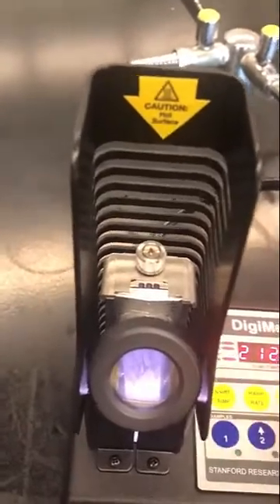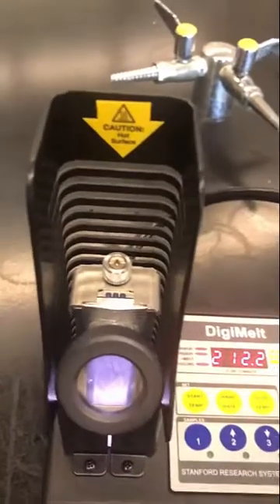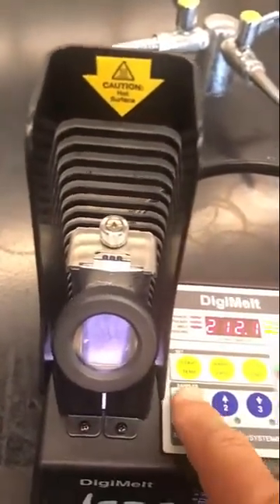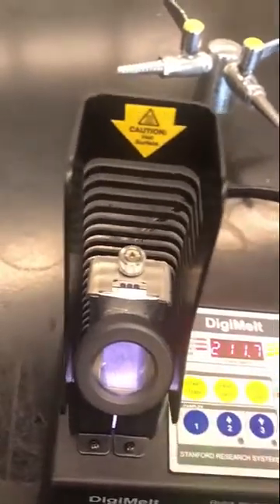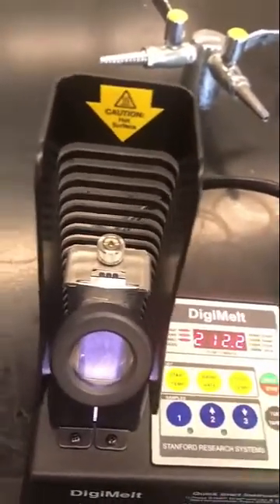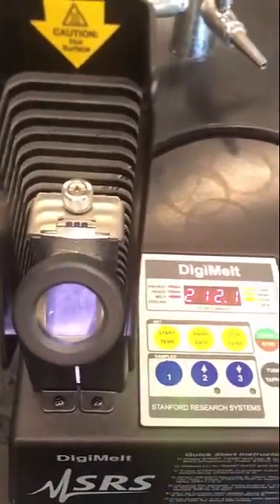Then as you go along and see a clear point, you can press that button again. Each sample position can record two data points — one for the sweat point and one for the clear point. Let's say this one's a little bit different, so I'll wait and then press it. Now I think it's done, so I can hit start/stop and it'll begin cooling. I can go back and review my data. There are four data points recorded total — two per sample position — and if you don't want to constantly look back and forth writing information down, you can just click the button as you observe.